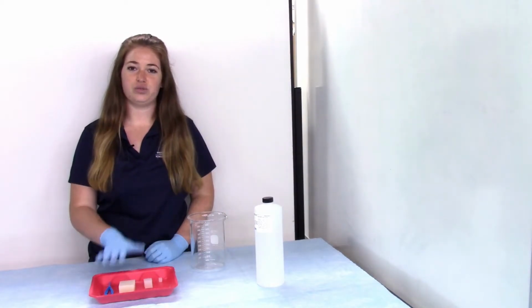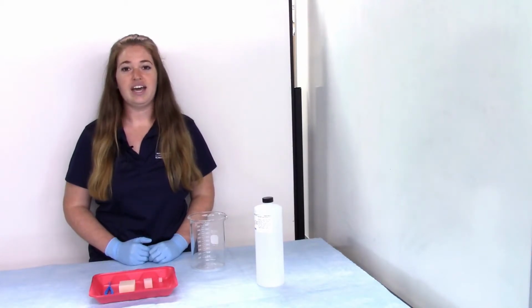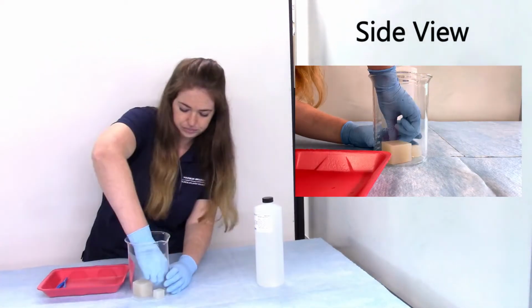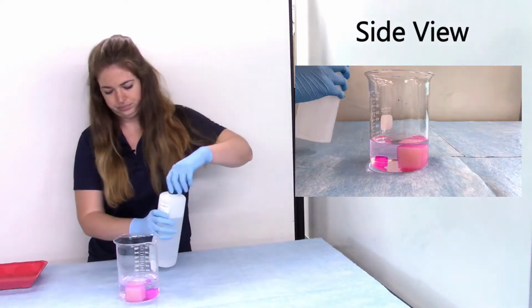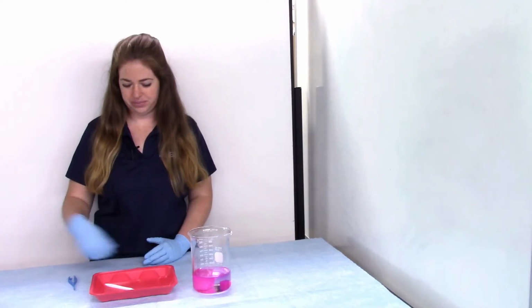I'm going to take these 3 agar cubes and place them in the beaker and fill it with sodium hydroxide. From there, we'll wait about 10 minutes to give the sodium hydroxide a chance to diffuse in, and then we'll take a look at our cubes. Okay, now that it's been about 10 minutes, let's take a look at our cubes.